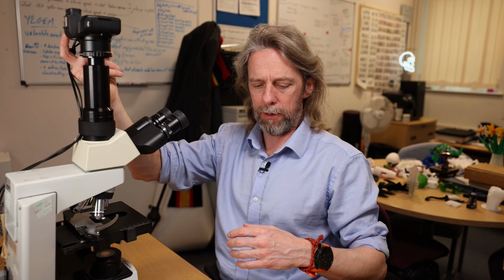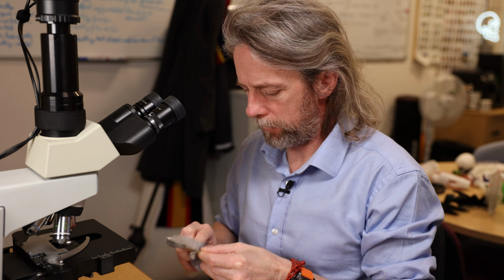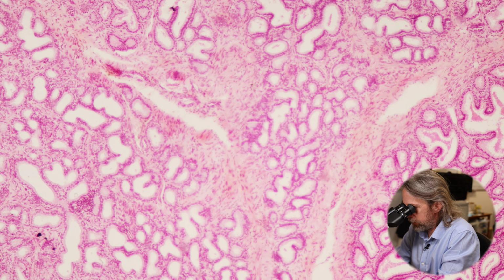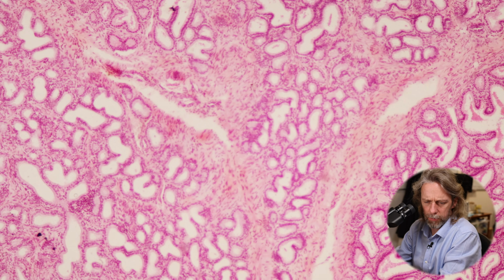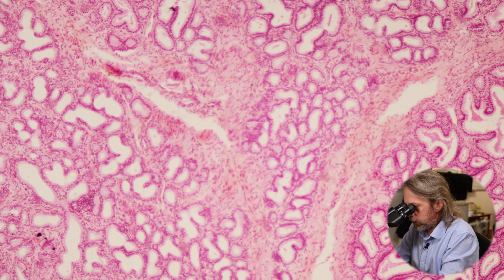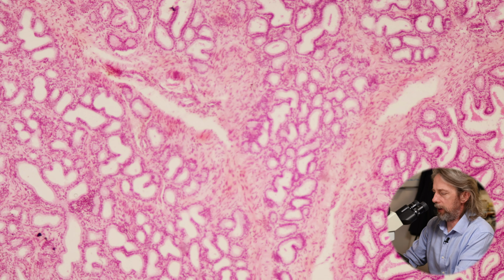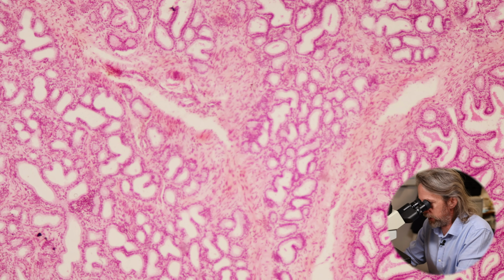Okay, right, let's have a look, shall we? We are looking for very similar things to what we have seen when we've been looking at other tubes and other bits of the body. How bright's that? A little bit bright, too bad. All right, what can we see? So I'm on my lowest power objective here, the 4 times objective, and then 10 times magnification to my eyes, giving me a total of 40 times magnification.